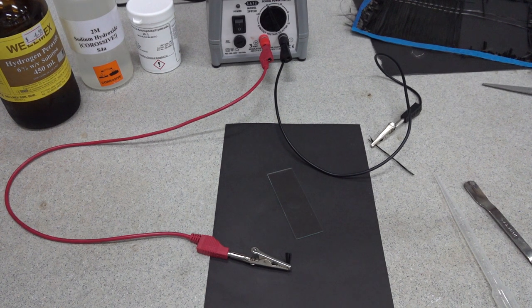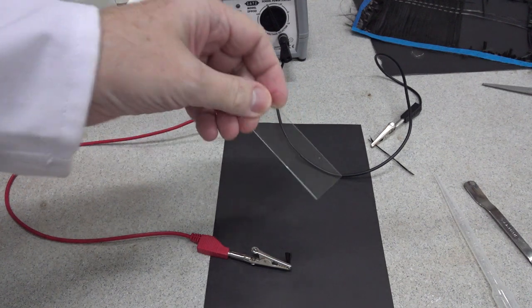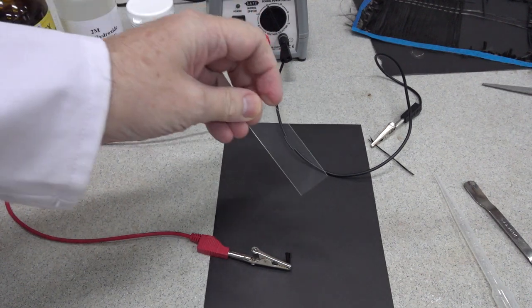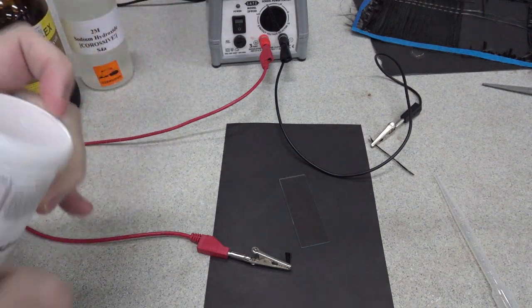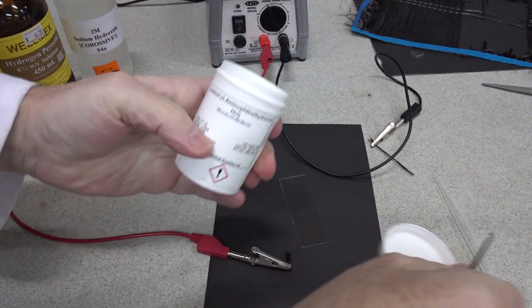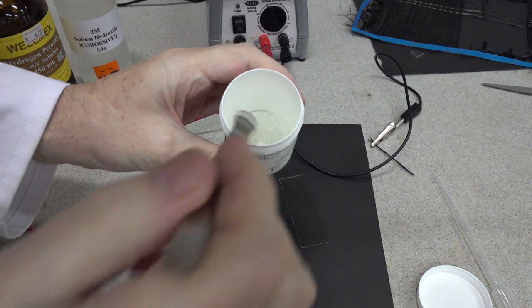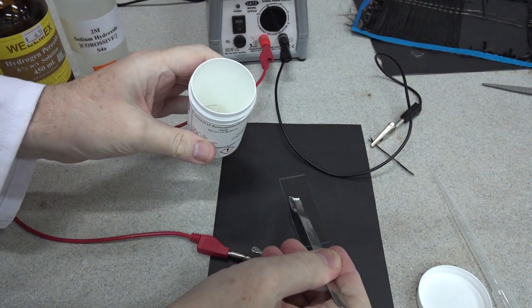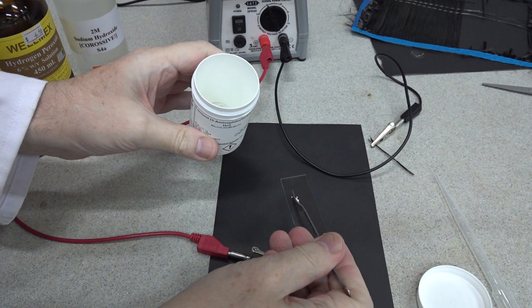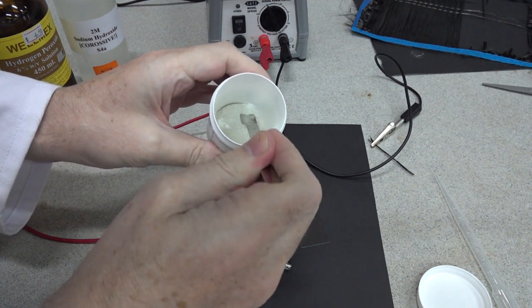Electrolysis of luminol solution on a small scale. We're going to carry out the experiment on this glass microscope slide. We start by taking a few milligrams of luminol, just a small amount of the solid, and place it on the slide, maybe a little bit more than that.